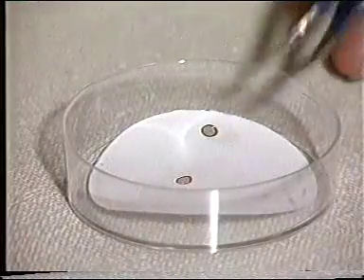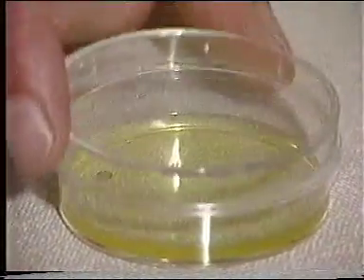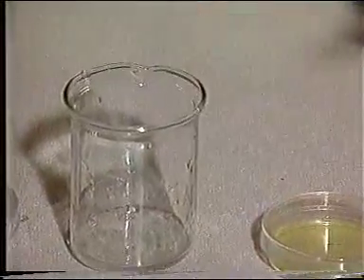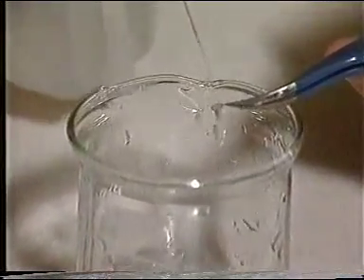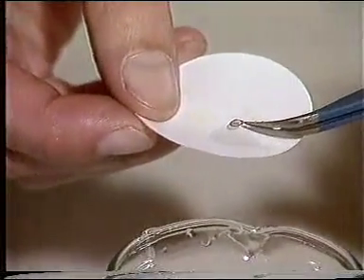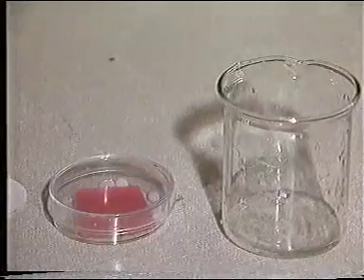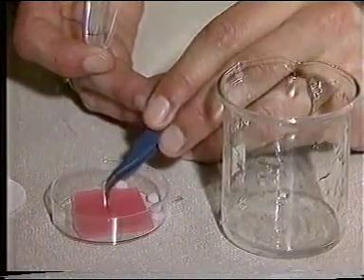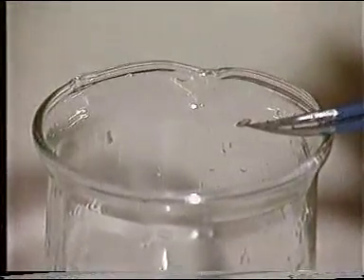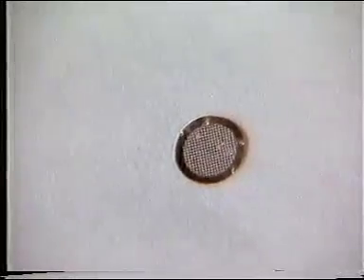Copper grids are used to support the specimen. We can't use glass because electrons have too low a penetrating power. They can't get through. The specimen is then stained. Firstly, in uranyl acetate solution, the uranium salts selectively bind to proteins and nucleic acids. Staining with a second compound, lead citrate, makes use of the ability of the lead salts to selectively bind to lipids. By this double staining technique, the contrast of cell components and membranes is greatly enhanced.